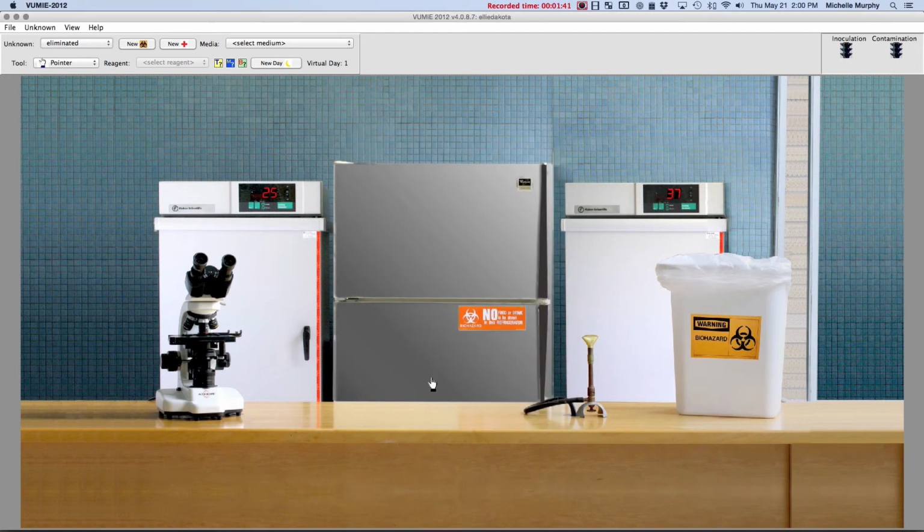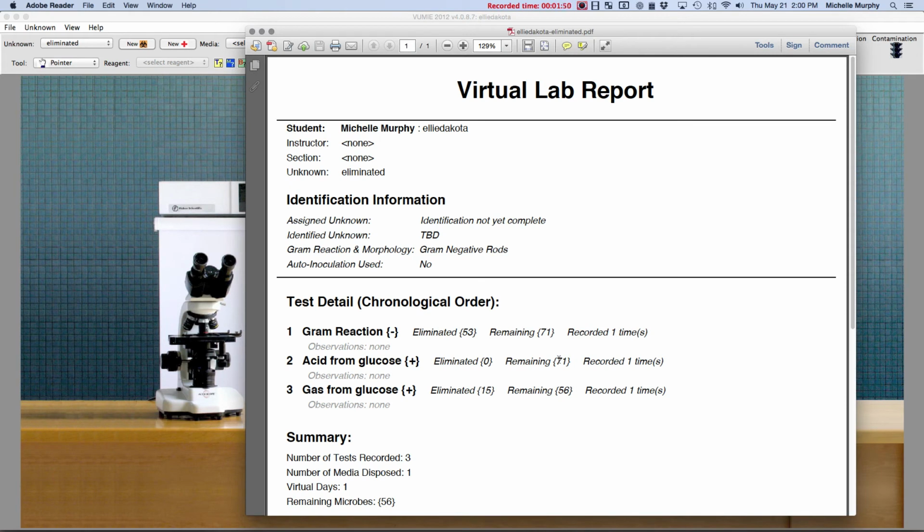Okay, doesn't tell me anything right off the bat. I don't know if it's positive or not, but if I go up to the lab report, we're going to see that we have 71 remaining after the acid test, 56 remaining after glucose. Looks like we're doing okay. We're still narrowing things down. We're getting that number lower than 71, so that's good. We're working it down. But what if I had put negative?